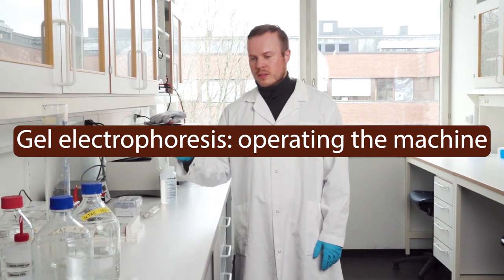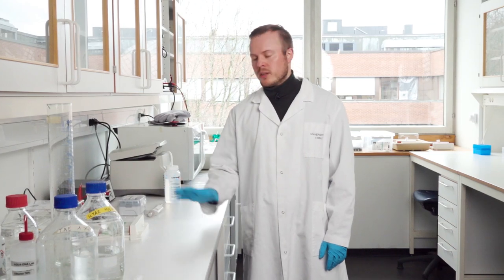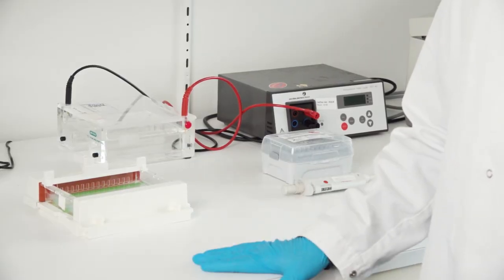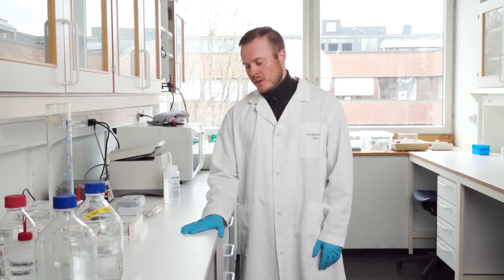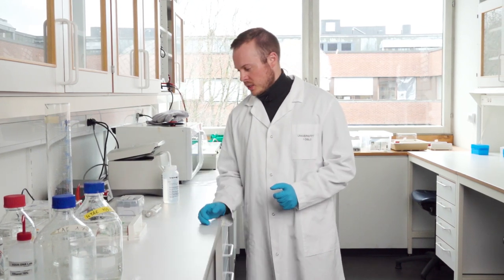So now the gel has started to solidify and we have been waiting for around 20 minutes. It still needs some more time, but in the meantime we can start the preparations for pipetting our samples into the gel and actually running the gel.